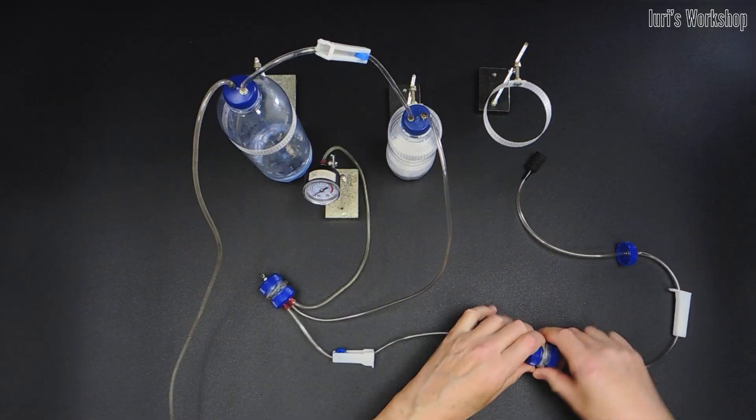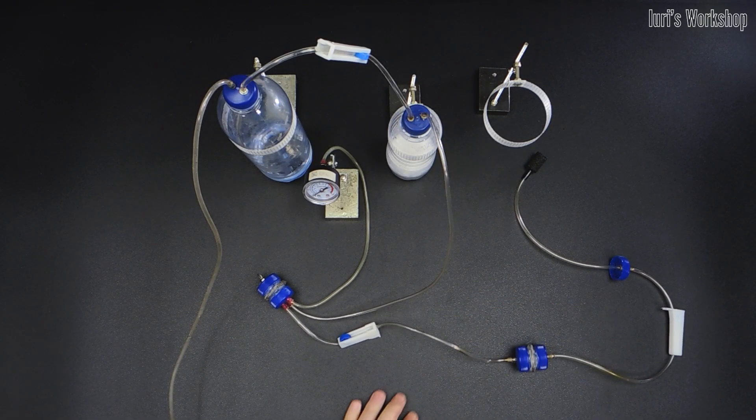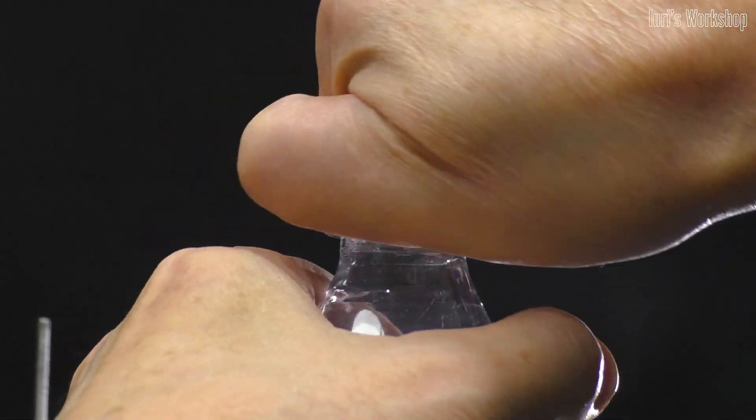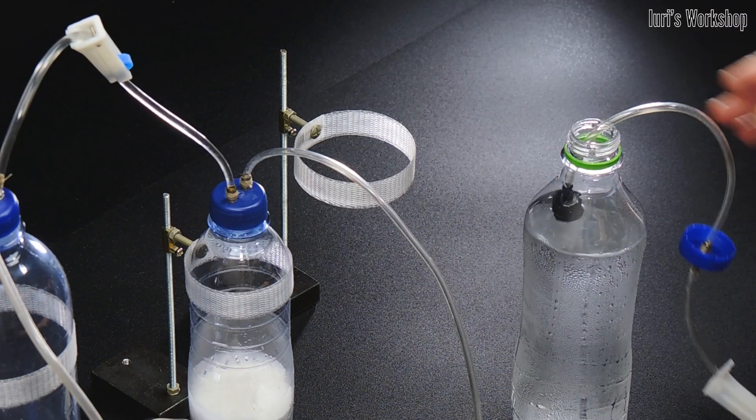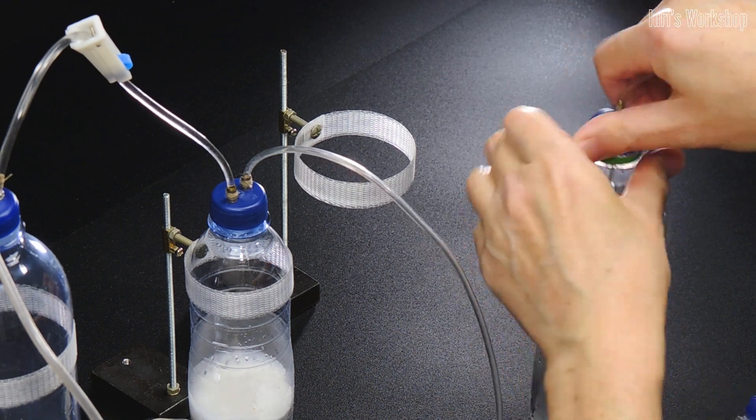The carbon dioxide does not support combustion and we can check for it with a lit match. Now let's connect the third tank with cold water to the second tank, having previously removed the air.